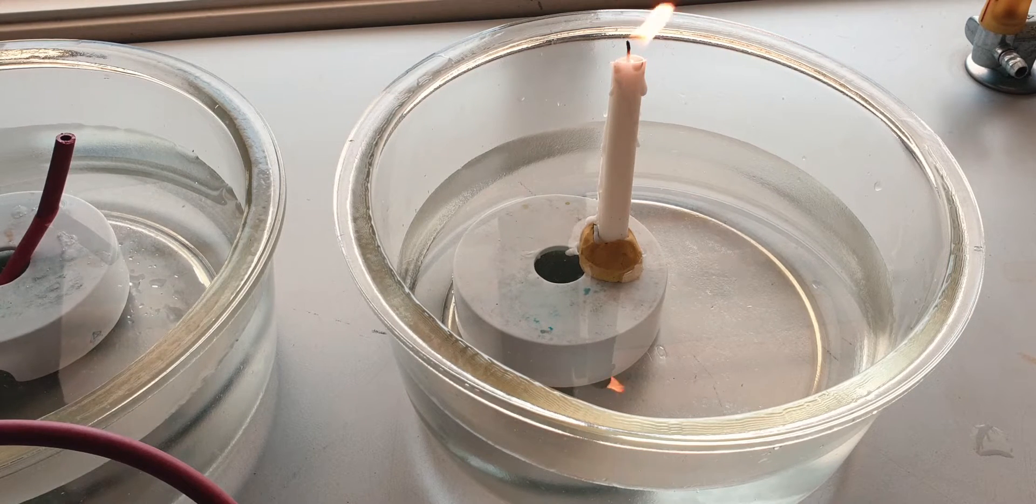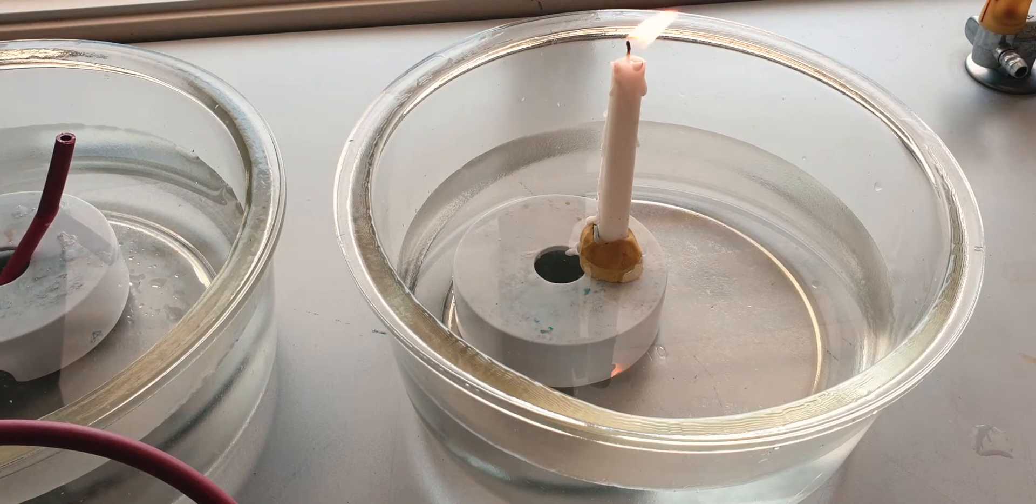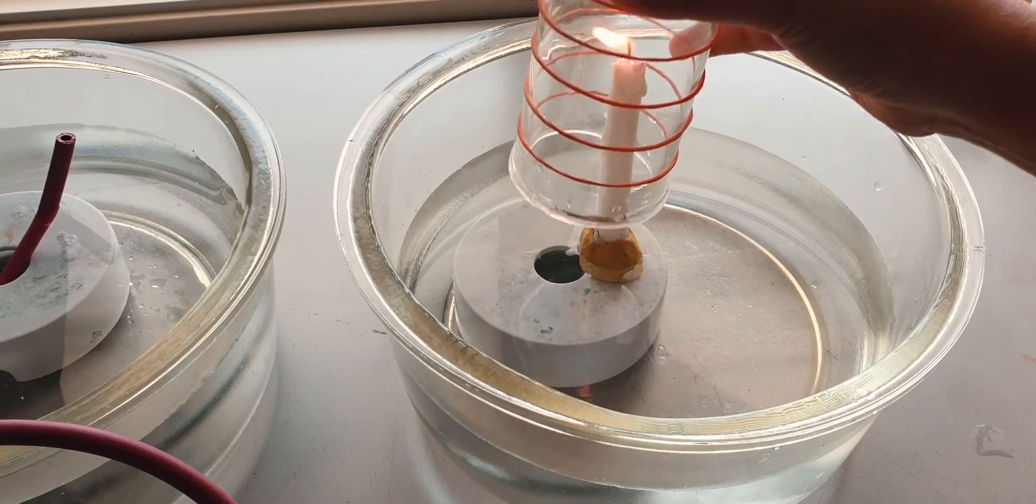You will see the water level is increasing.